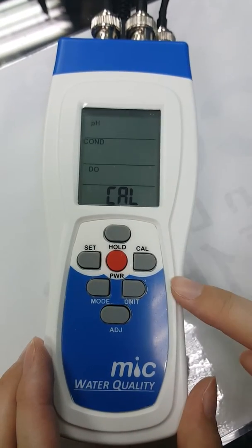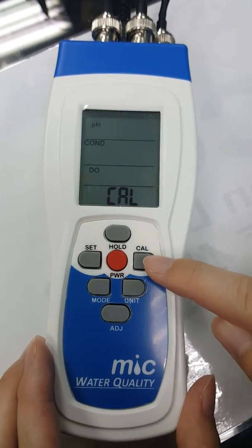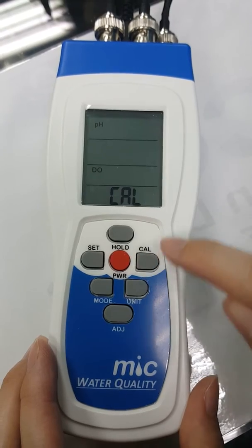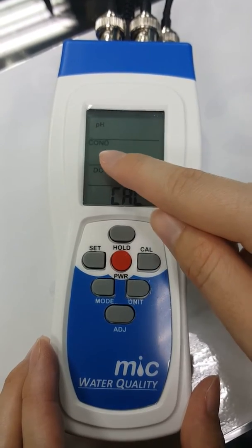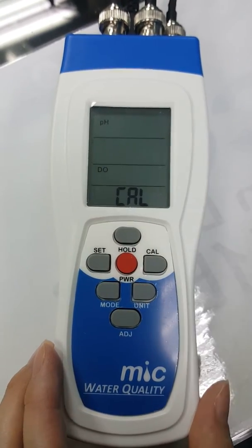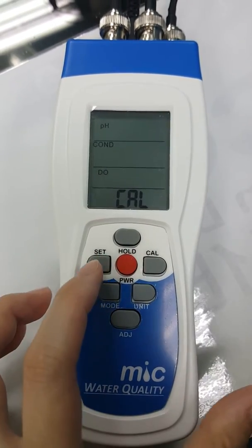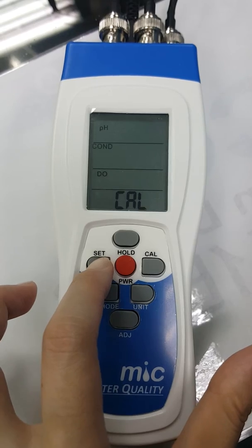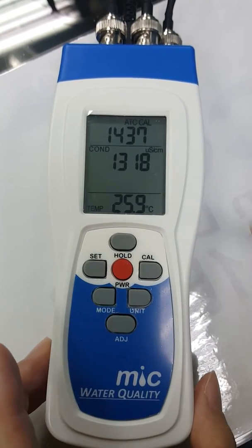Short press the calibration button again to select conductivity, and then long press the set button to enter calibration mode.